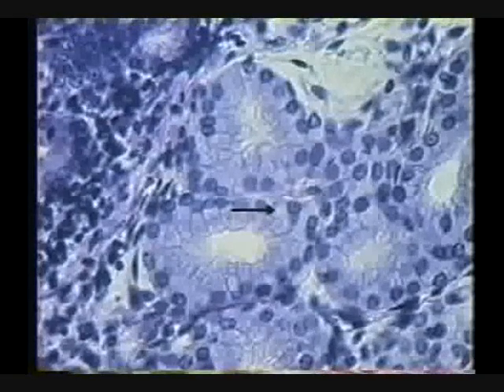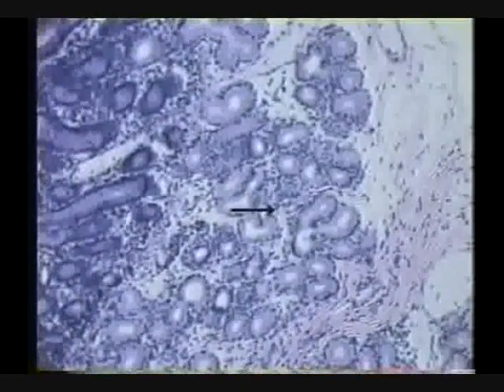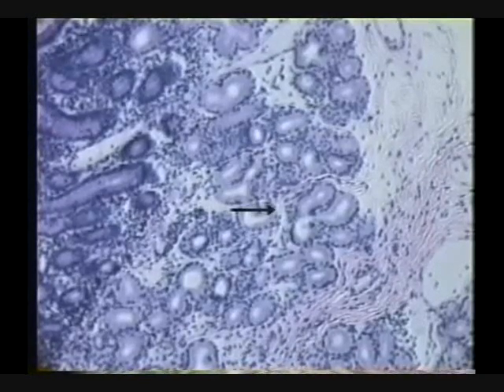And Brunner's glands, and now listen to this, are typically in the submucosa, but once in a while we'll find them up in the lamina propria. Okay? There's not a hard, fast rule over where they have to be. And once in a while you'll get down about this far and you'll find a nice muscularis mucosa going through there. So don't let that worry you. It's just a variation you're going to run into.